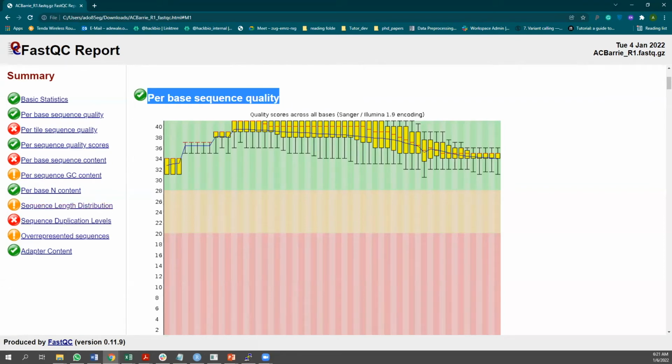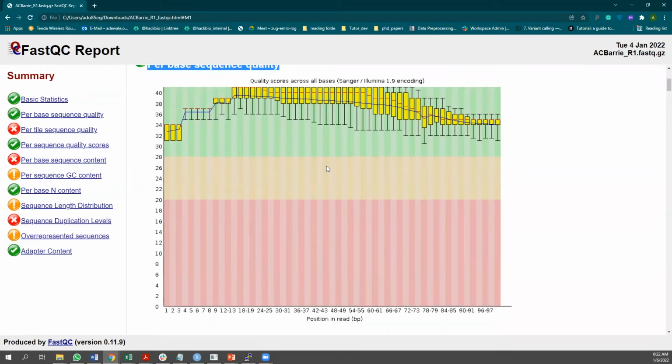the file. For starters, you need to know that you sequence in fragments. Now, these fragments have specific sizes, okay? For example, some people sequence in 150 base pairs, some people sequence in 100 base pairs. And looking at this, looks like 100, yeah? So you sequence in fragments. And when you sequence in fragments, this plot is showing you what the average quality score of sequence is at each position. Say you sequence 100 base pair fragments, at position base pair number 1 to base pair number 100, this plot represents the average quality score which is reported for the sequences identified at that location.